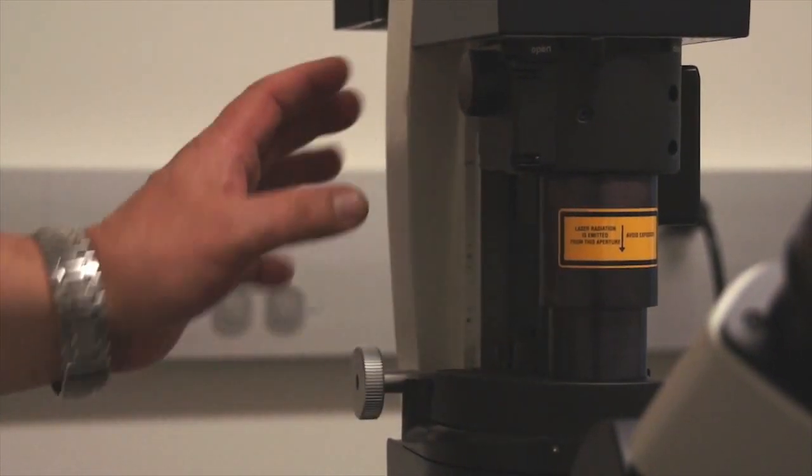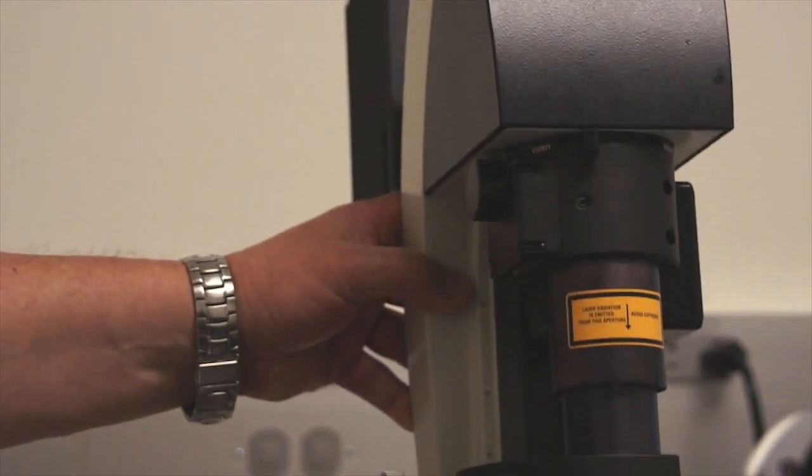Another important feature of the Leica SP5, particularly related to inverted microscopes, is that the illumination arm can rock out of the way.